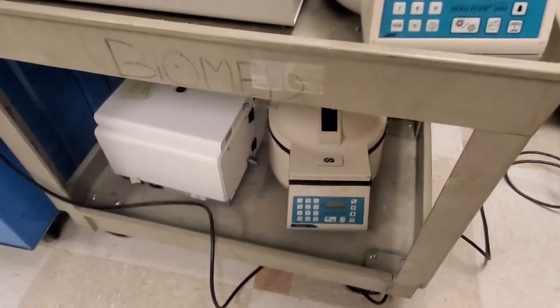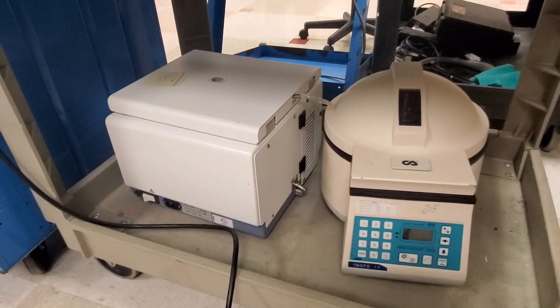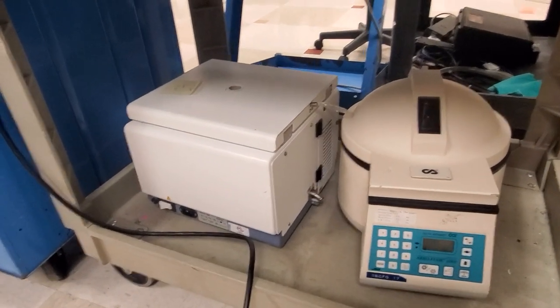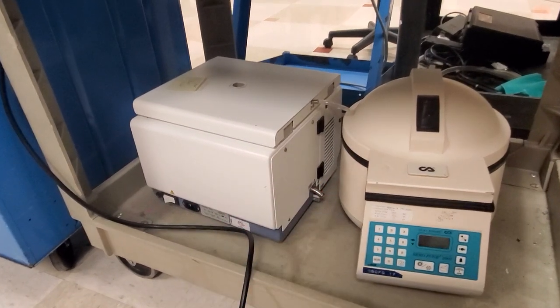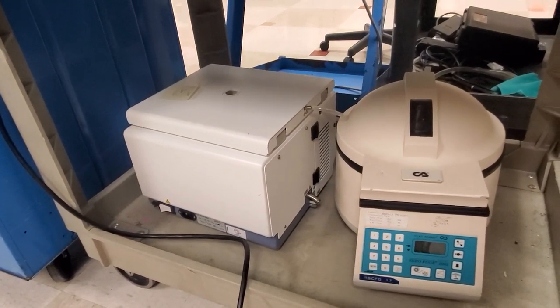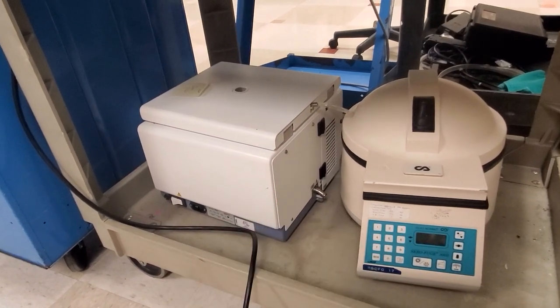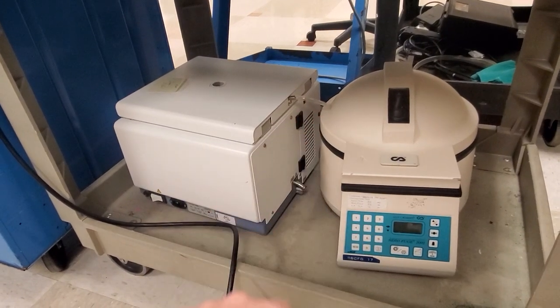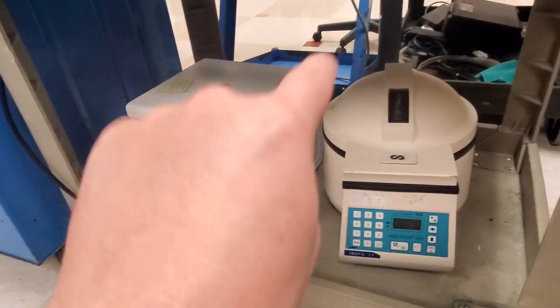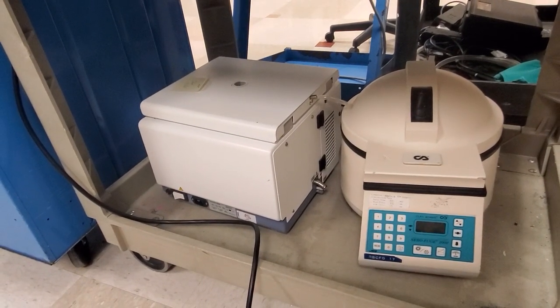You can see right here I've got other centrifuges, and this guy is a special centrifuge — it's called a cell washer. It irrigates saline in above the test tubes that are rotating and it allows it to separate components of blood. It's a centrifuge that has a little line for irrigation that goes up into the lid and it sprays directly down on top of the test tubes.